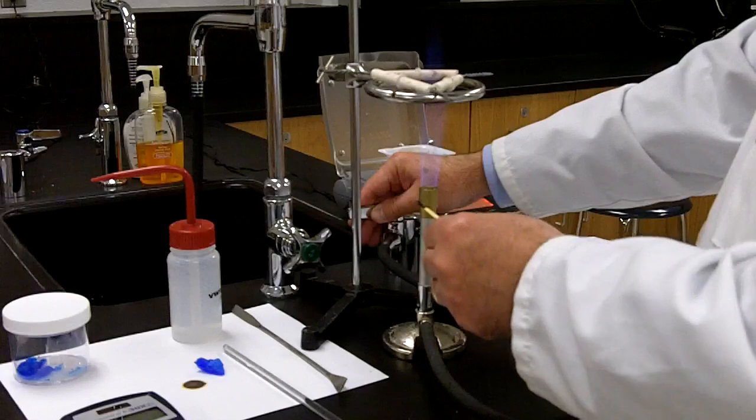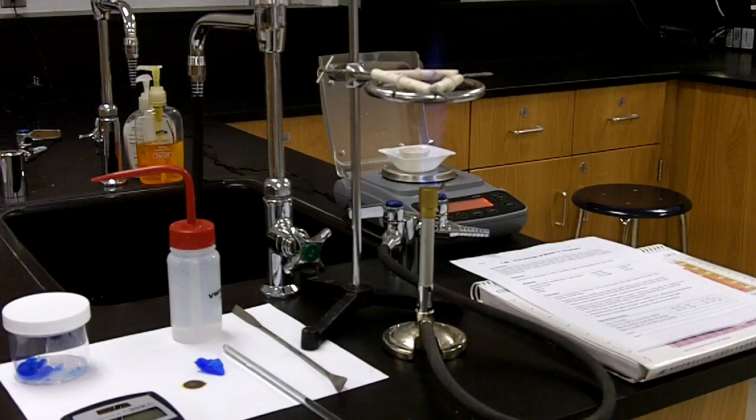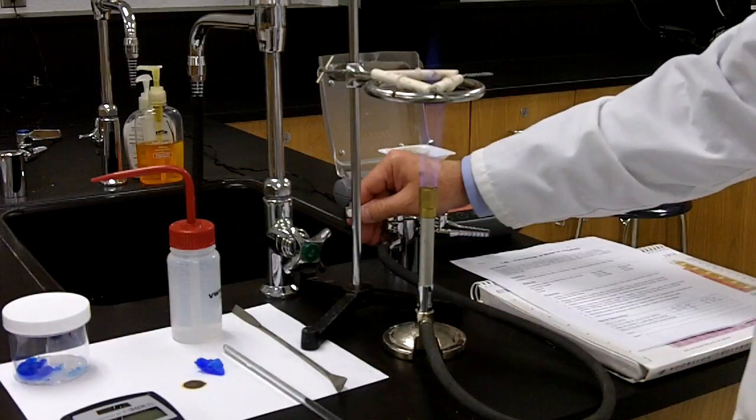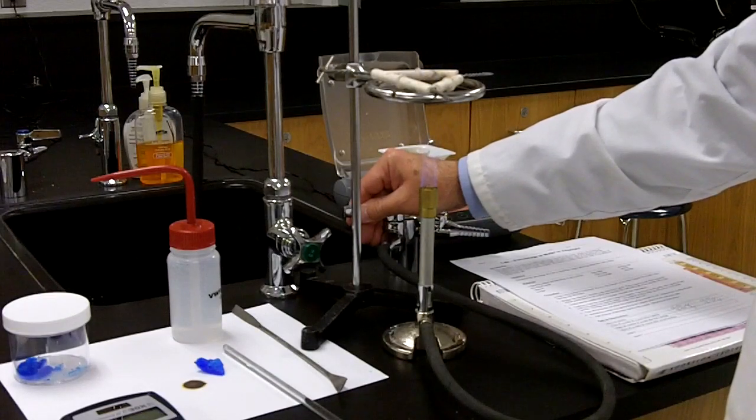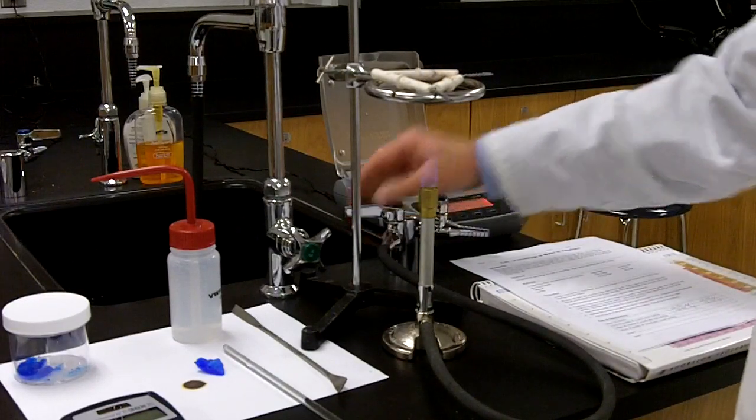Just slowly start the flame, and it catches pretty quickly, just like that. I don't need a terribly hot flame, so I'll back the flame up quite a bit. That's fine. That's more than enough, right there.